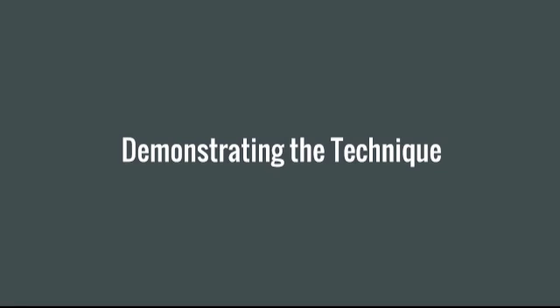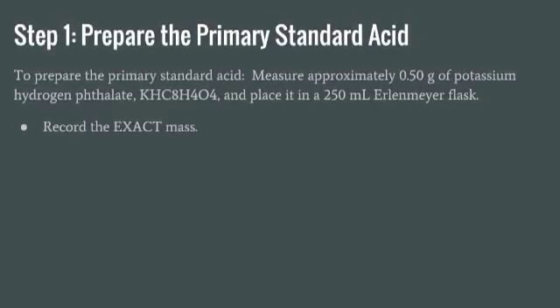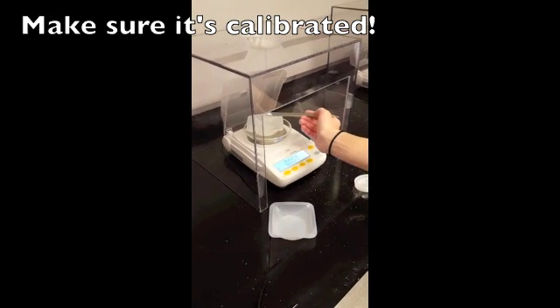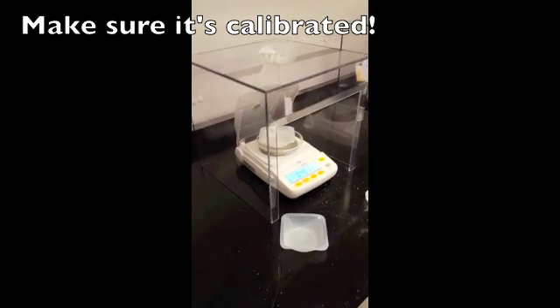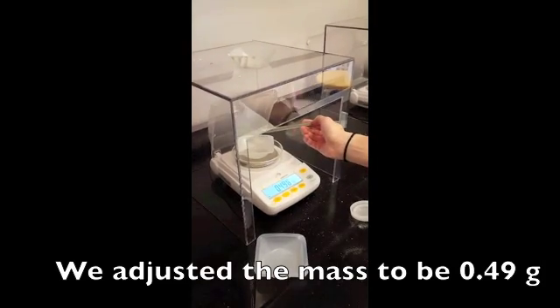After you've collected all your materials, you will then go through the procedure of the lab. In this, we will demonstrate the technique. So the first step is to prepare the primary standard acid. To do this, you measure approximately 0.5 grams of the potassium hydrogen phthalate and place it in your Erlenmeyer flask. It's alright if your mass isn't exactly 0.5 grams, but be sure to record the exact mass.